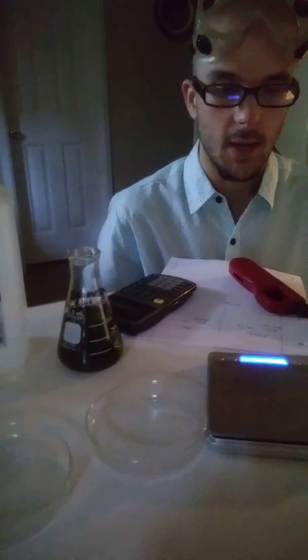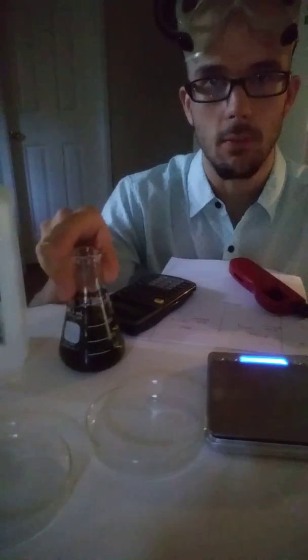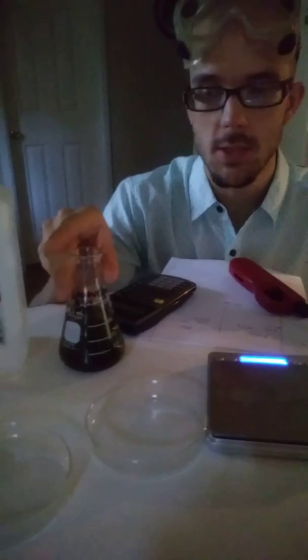We're going to record some before and after masses in order to answer the question of what happens when ethanol burns — we're going to look at the mass and also see if there are any chemical changes.